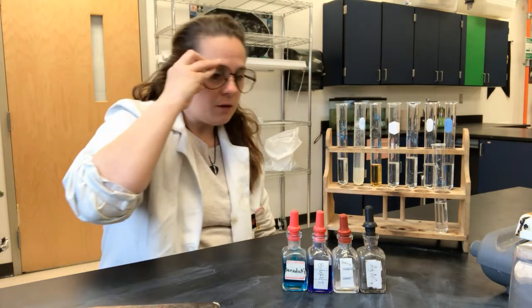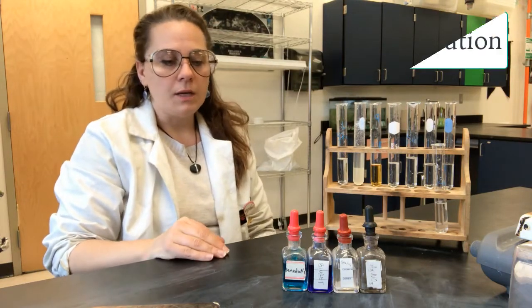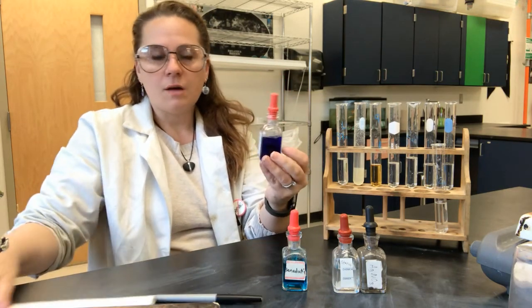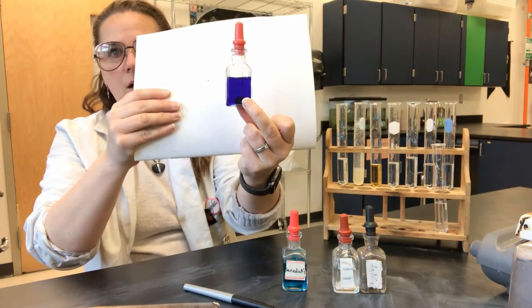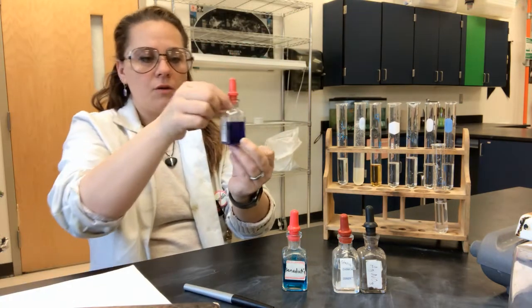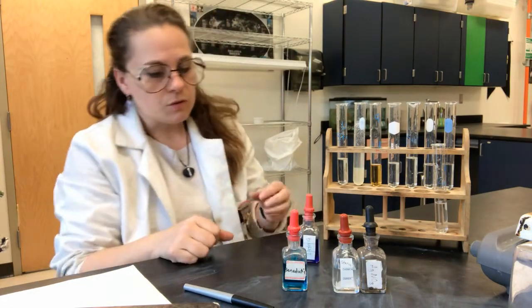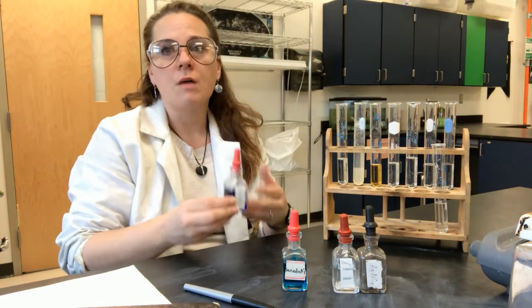The first indicator I am going to look at is called Biuret solution. Biuret solution is right here — it's a fairly blue-looking indicator initially as it starts. When you're doing these tests, the most important thing is that the indicator changes color. We are going to use this particular indicator to determine whether or not proteins are present in the solution.